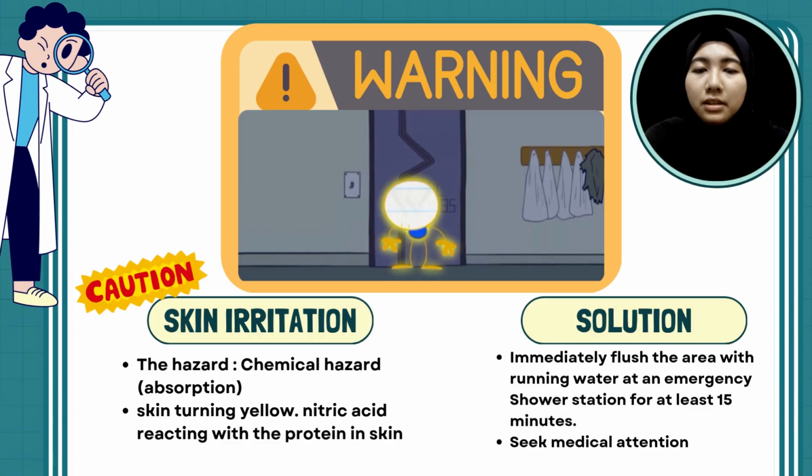So what is a chemical hazard? A chemical hazard refers to any chemical substance or chemical-related activity that has the potential to cause harm to human, property and environment. When nitric acid touches the skin, it can cause a chemical burn and absorption. The yellow color seen on the skin is due to the acid reacting with the protein in the skin.